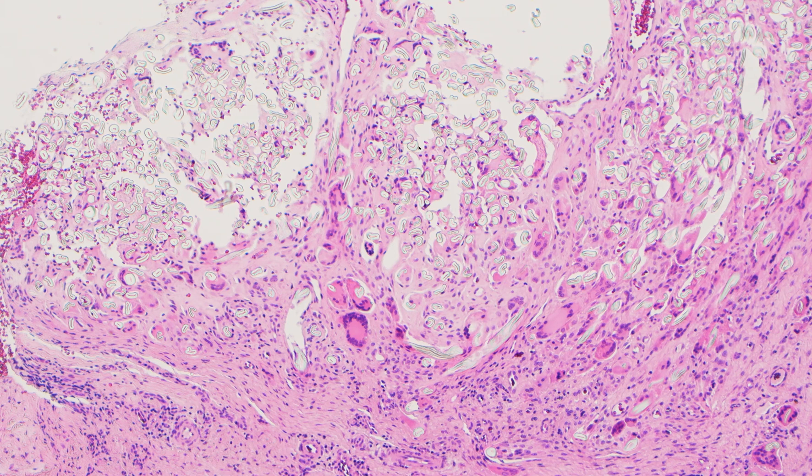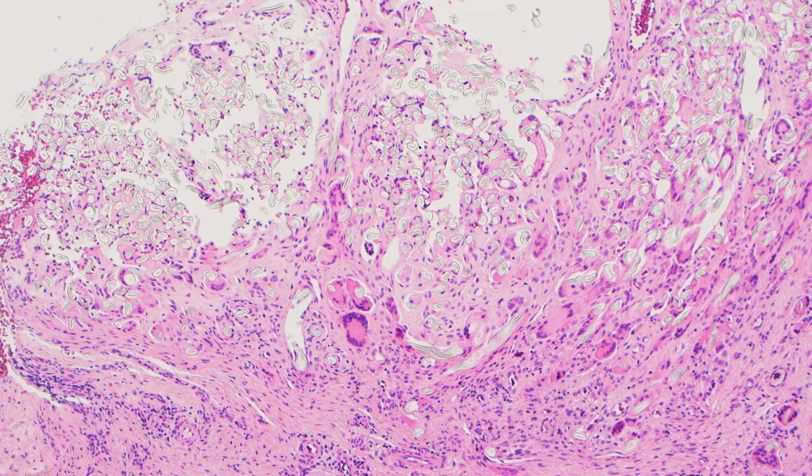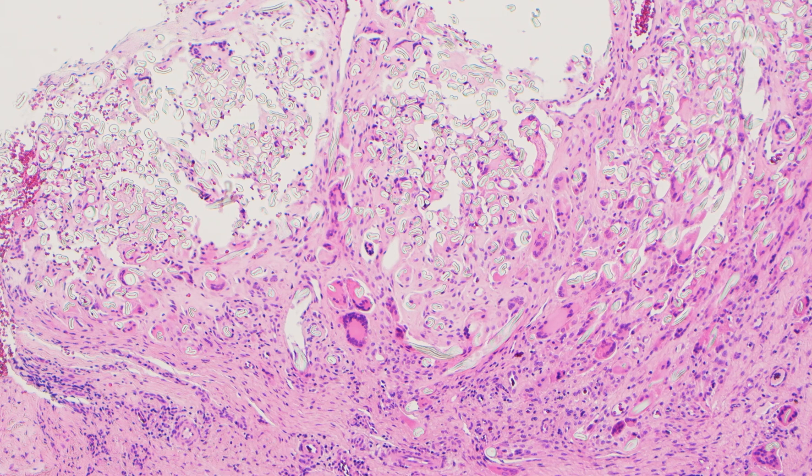I love digital pathology and digital slides, but this is one thing that, as far as I know, digital slide scanners don't offer. As a dermatopathologist, I encounter foreign material often in the skin, dermis, and soft tissue, so I'm often flipping my condenser back and forth to help me see foreign material, especially if there are a lot of granulomas around.